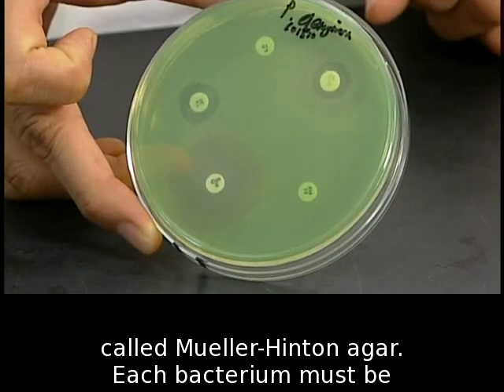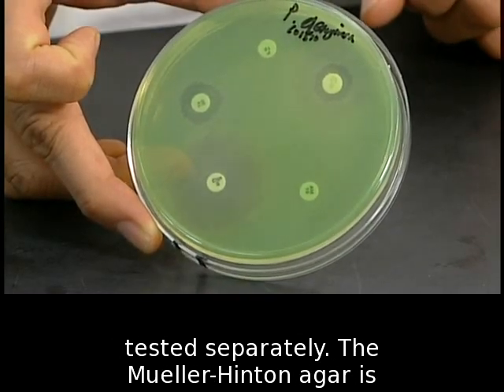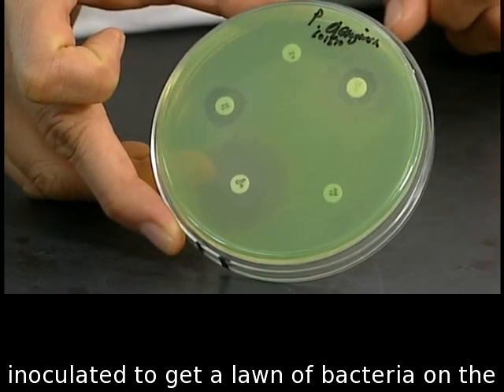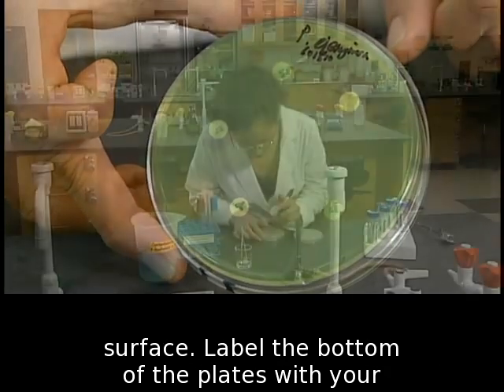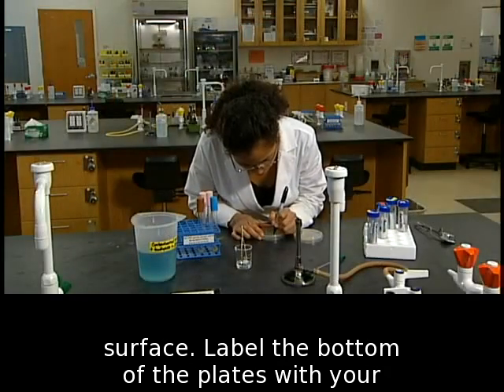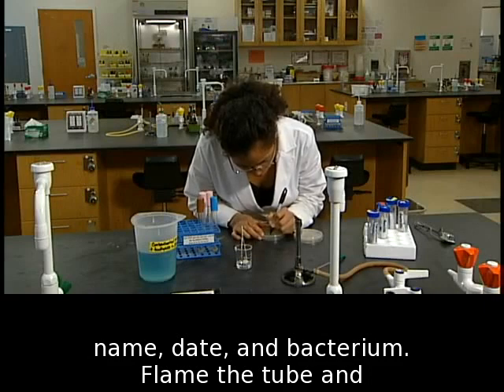Each bacteria must be tested separately. The Mueller-Hinton agar is inoculated to get a lawn of bacteria on the surface. Label the bottom of the plates with your name, date, and bacterium.